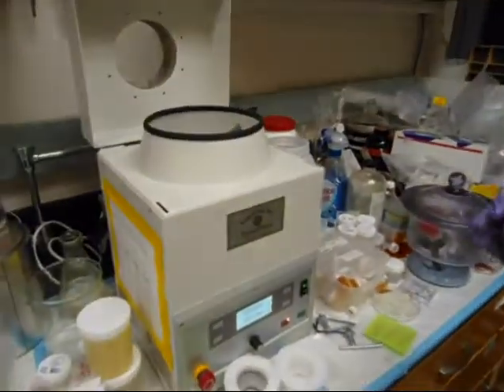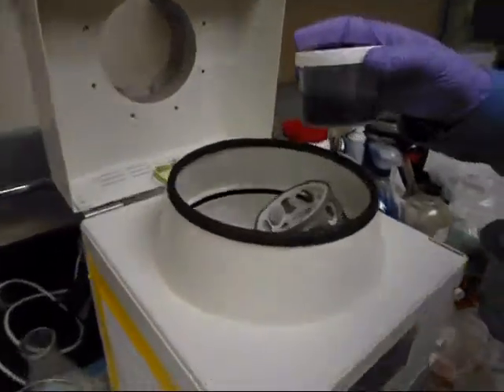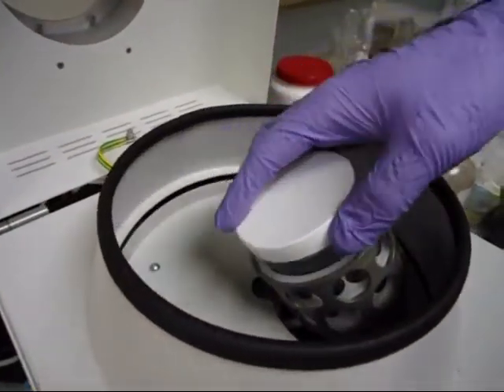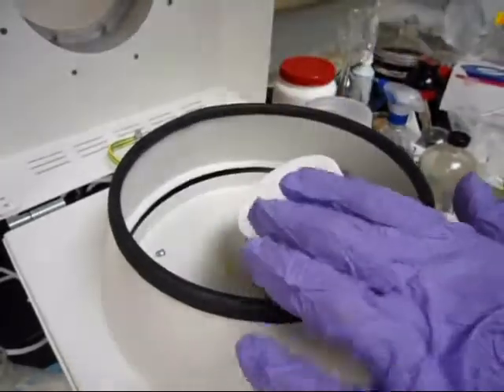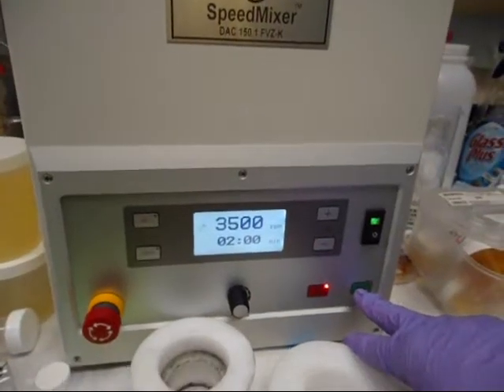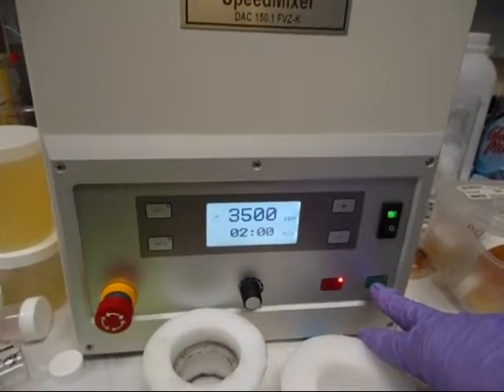This is the speed mixer. We are going to put the container of THF into this plastic holder. Now we are going to start the mixing.